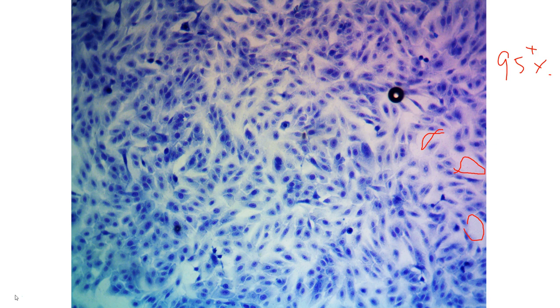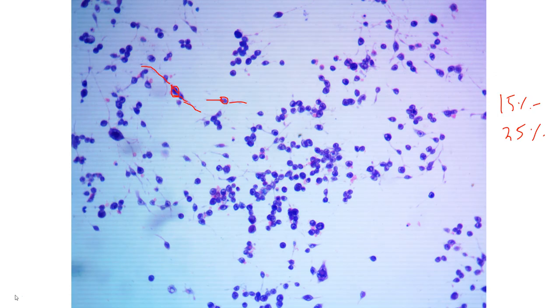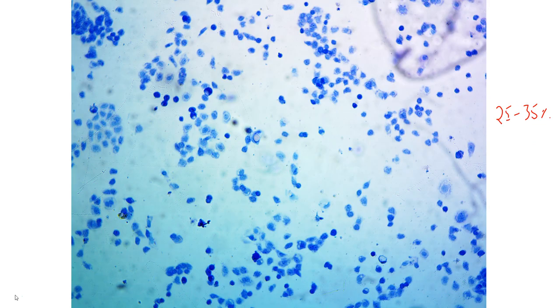Okay, so I hope this little tutorial was helpful in figuring out how you look at confluence measurements and decide the confluency of your cell culture when making some qualitative observations about your cells at the beginning and end of experimentation. We use this to equalize our samples, since many times when we are starting our experiments, not every single plate of your culture is going to be exactly the same. So by looking at their starting and ending confluency, we are able to make a ratio between the start and the end. You're able to equalize them somehow, give them some sort of a benchmark to compare to. And we will be doing some of that in cell viability in a couple of weeks.